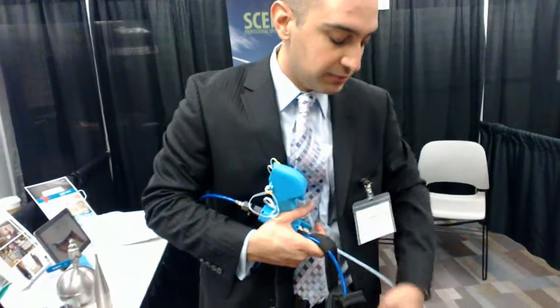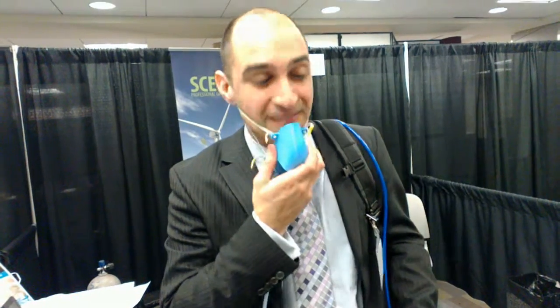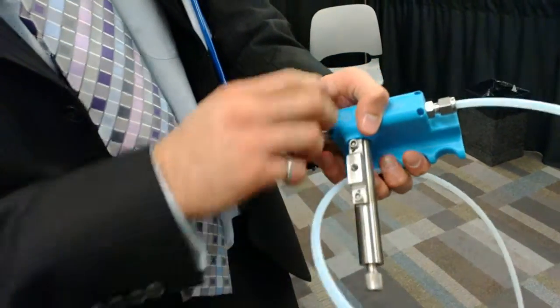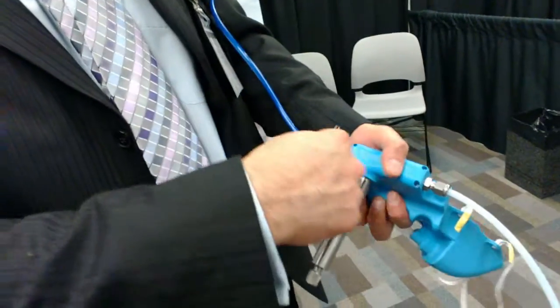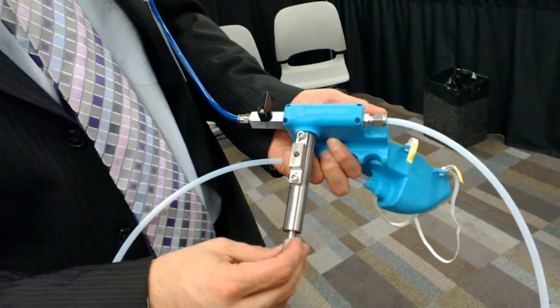Then you wear the mask. Let's say I'm doing an ambient sampling — I would put on the mask. I'll start my analysis by closing down the valve here and opening it up, and we'll have fresh air coming. This is just to clean your nose. As the air passes through, there is a stainless steel venturi pump underneath, and this creates a vacuum inside this chamber. I can now allow some sample to be pulled in from here.